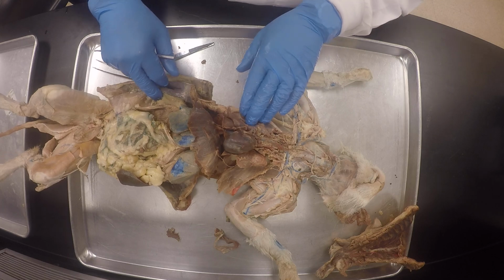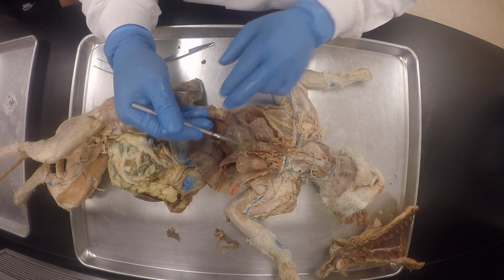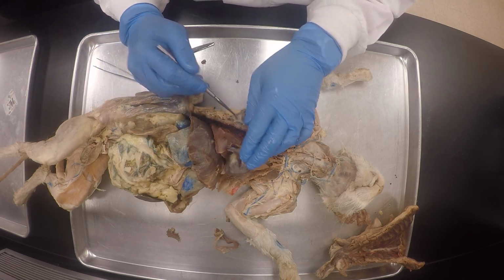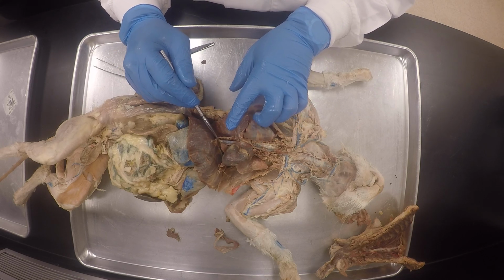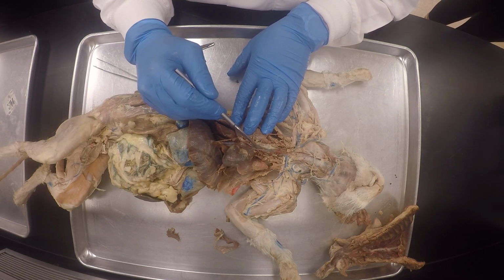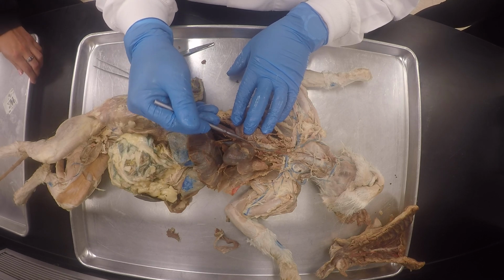And then of course the inferior vena cava, and this, you see the phrenic nerve, and then the phrenic nerve on this side. You see how it's going to the diaphragm? See this phrenic nerve? It goes on both sides, and they both go alongside the inferior vena cava, which is this. And there's the azygos vein, do you see it? It goes into the superior vena cava just before it enters the right atrium. So there's the azygos vein.